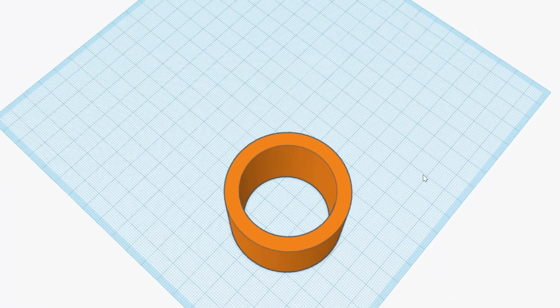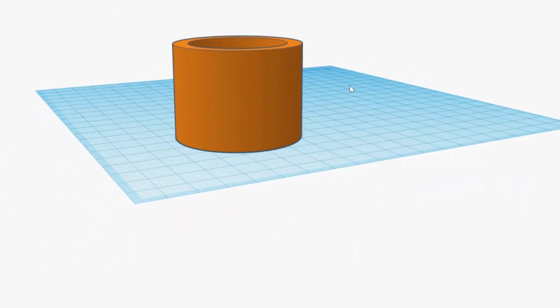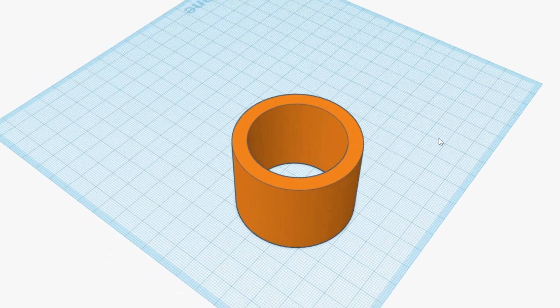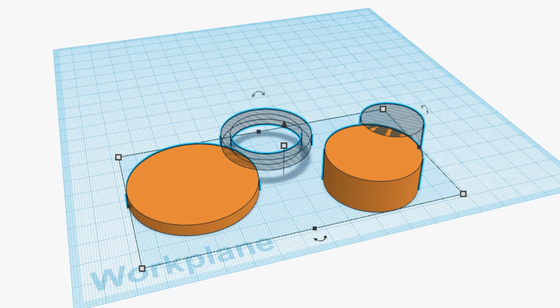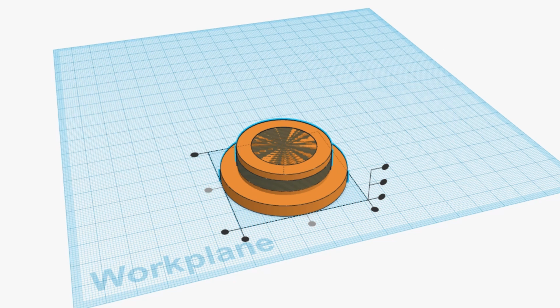I used a free online web application called Tinkercad to design the adapter, and I designed it in several pieces. So this here is the main tube. And I'm just looking around here a little bit to show it to you. The bottom part I printed separately because it's easier to print this way, and it also gives me a little flexibility in case I want to reprint something. I don't have to print everything again because the printing time was quite long. So I made different parts and then ultimately assembled it.